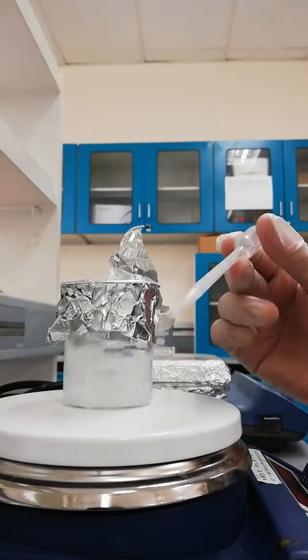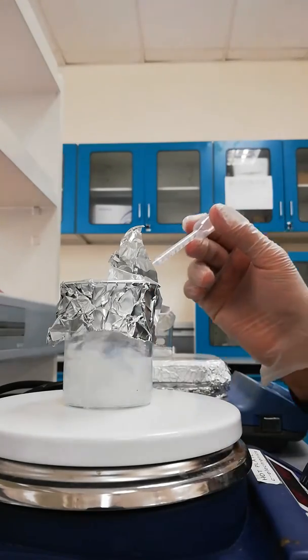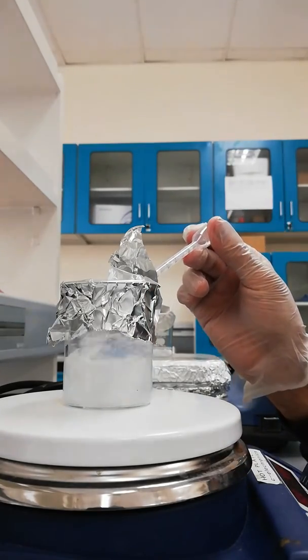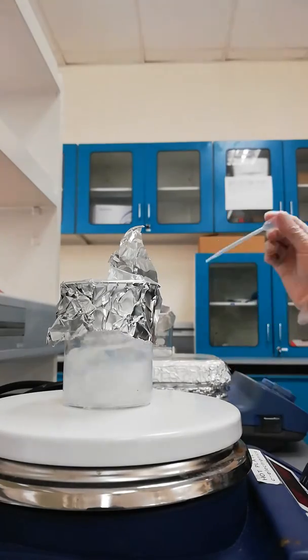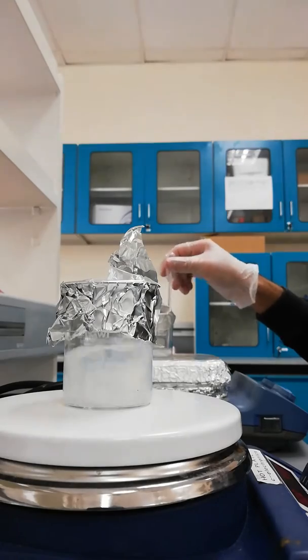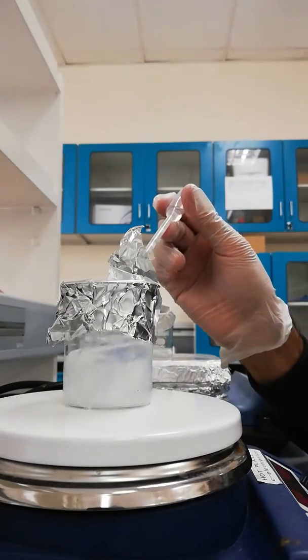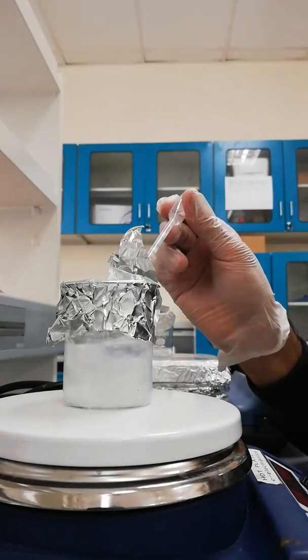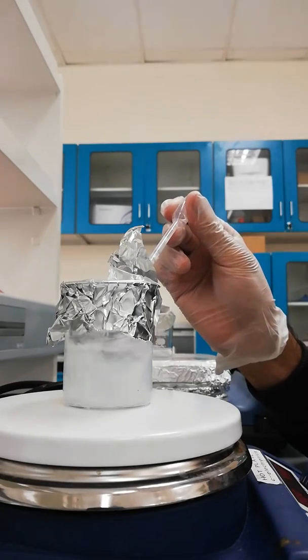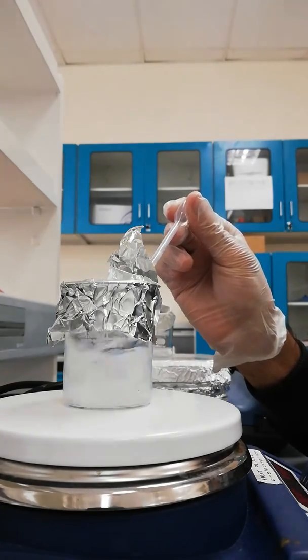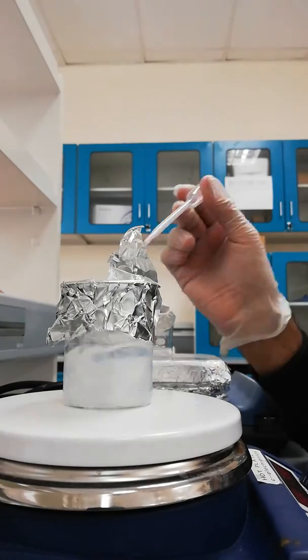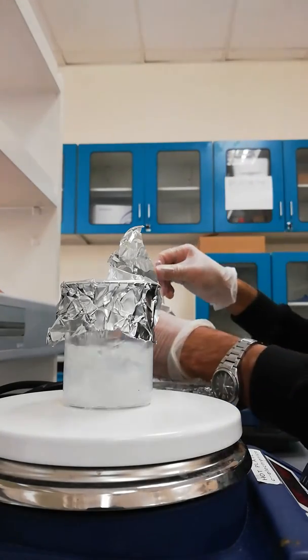I have a pipette full of sodium hydroxide and I am adding it dropwise into zinc acetate solution to make the zinc oxide nanoparticles. It's turning whitish now. It should get its whitishness disappeared by the end when I finish my sodium hydroxide solution.